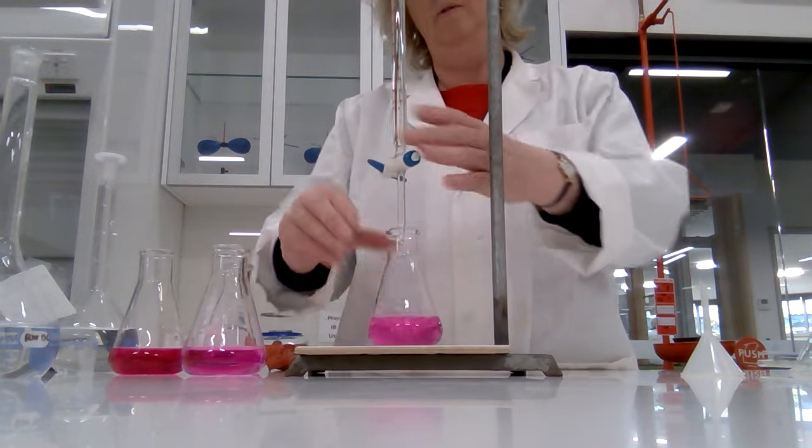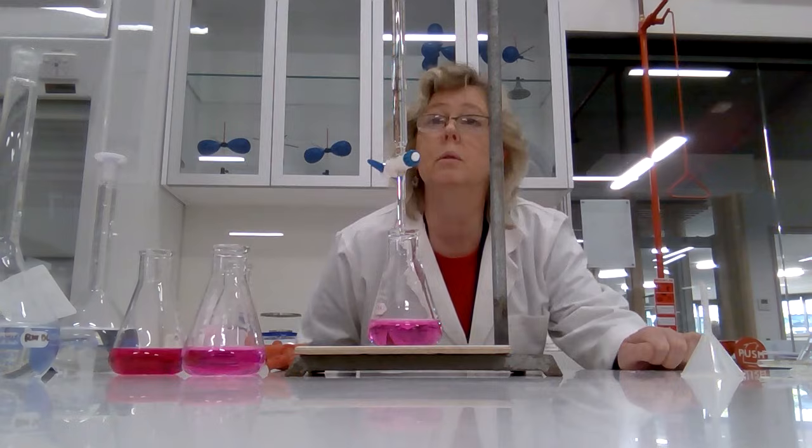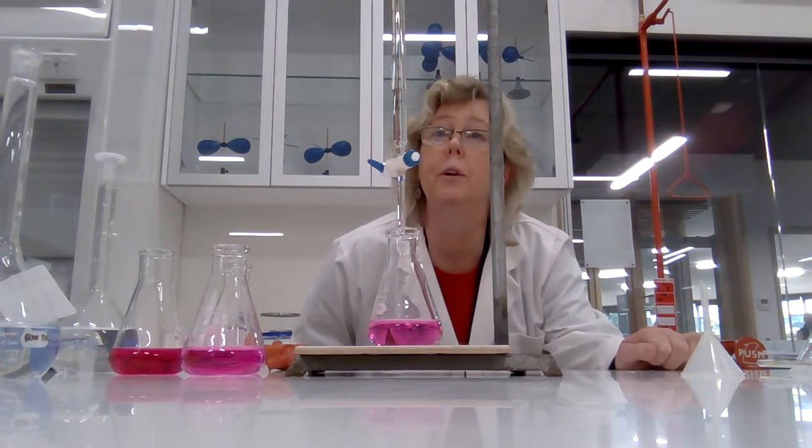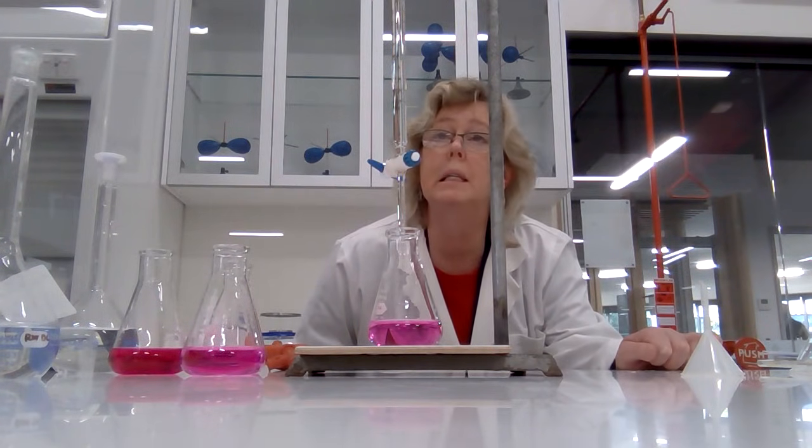There it is. All right. Oh, that's pretty good: 40.85.